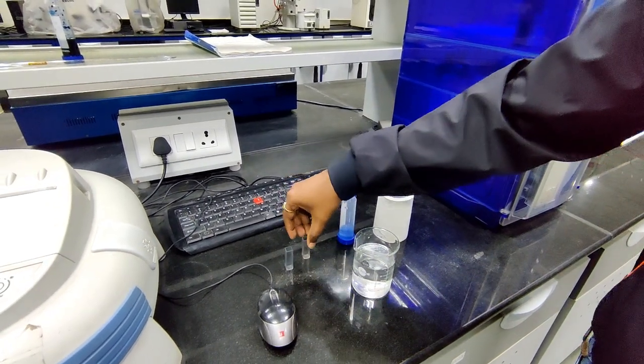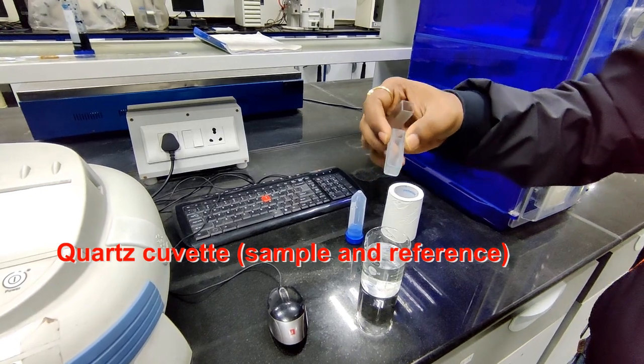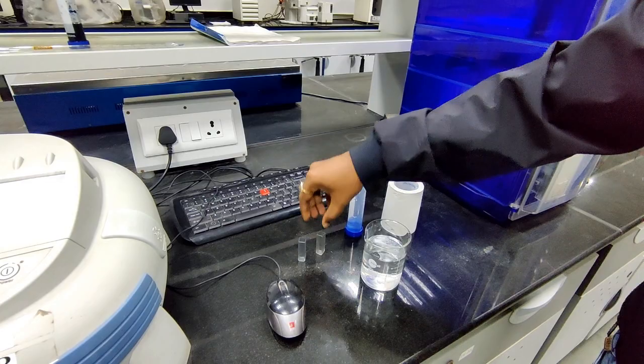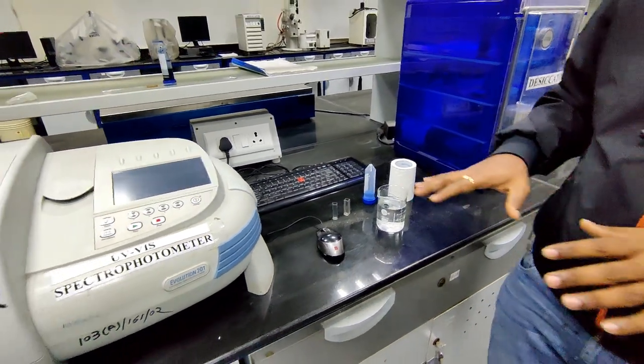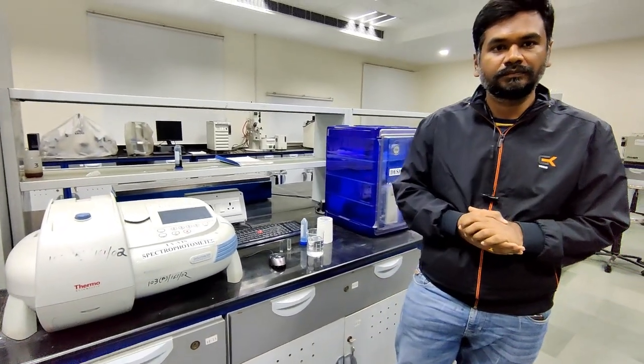We use two cuvettes, one for the reference and another for the measurement. To clean them, we use a tissue roll. These are the basic requirements for this experiment.